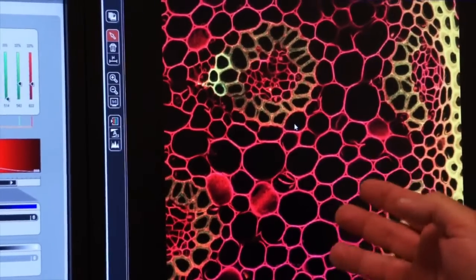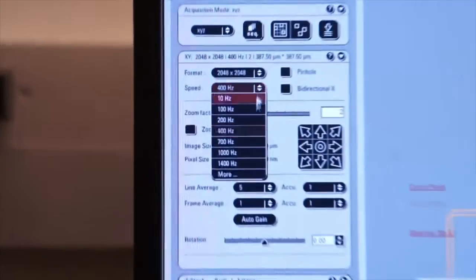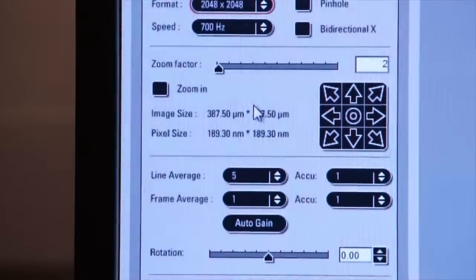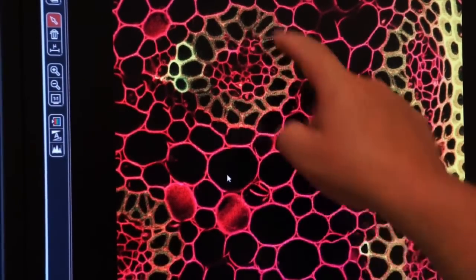How do I increase that speed? Well, I can go back over to my speed pull-down menu, and let's say I want to increase it to 700 Hertz. So now I'm going to capture my image, we'll watch it again, and this should prove to be a little faster than it was last time. Well, you can't appreciate the speed. It is going a little faster than it was before. And as a result of the speed, you see the trade-off that there is some pixelation.